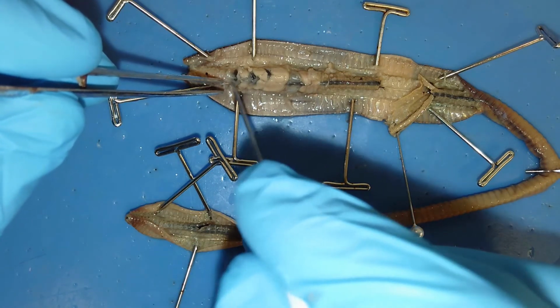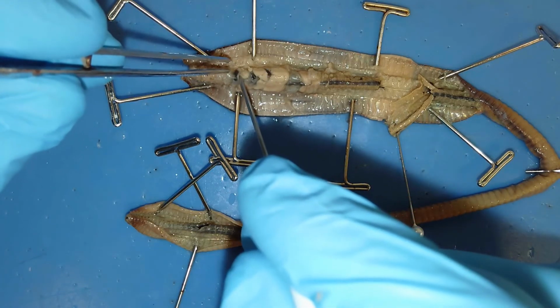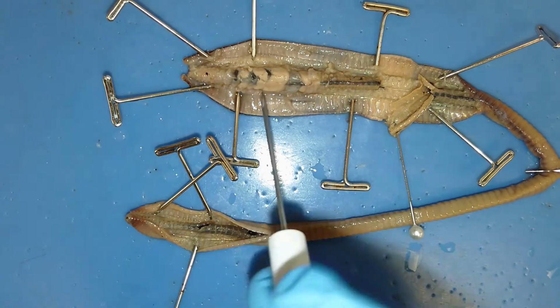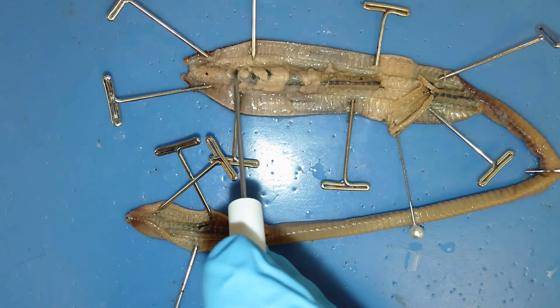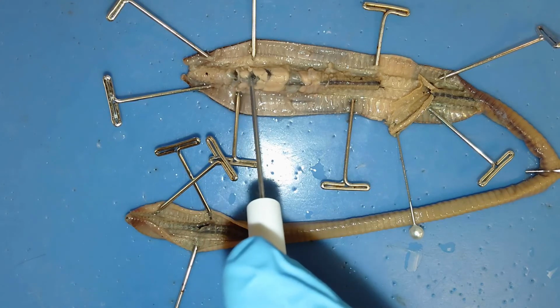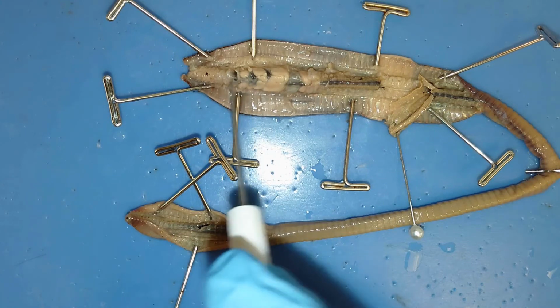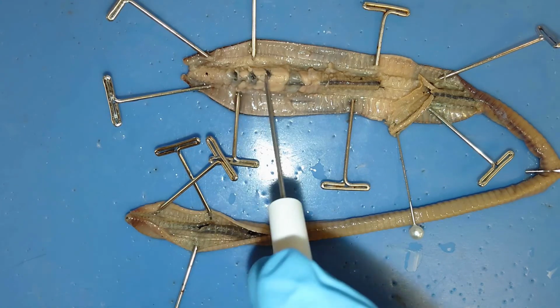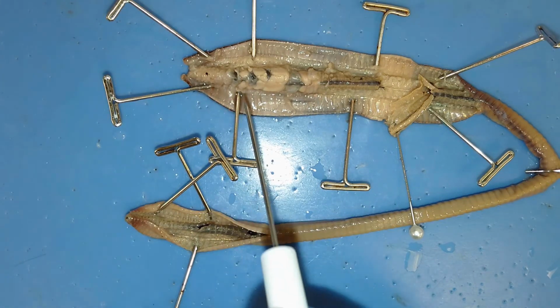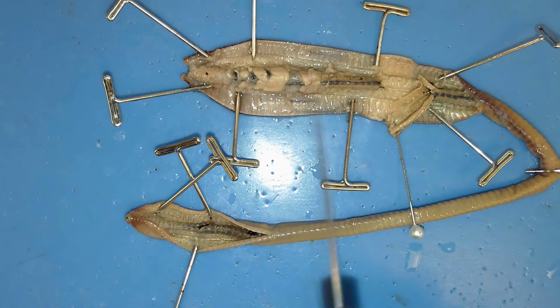That blood vessel originates, let's see if I can get this one pumping vessel shown. So that dorsal blood vessel originates right here. If you look, there's this thin black structure here, there's one here, and there's one here. There's another one that's covered up, and there's the same thing on the other side. Each one of these structures is a pumping vessel or a heart, and so this is constantly constricting and then pushing fluid down the length of the body.